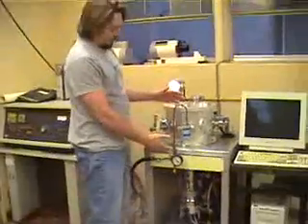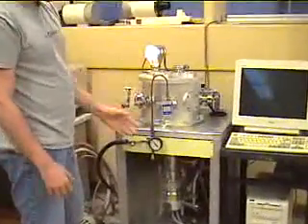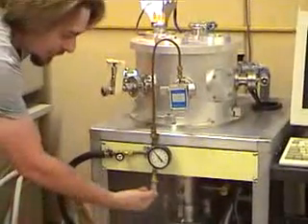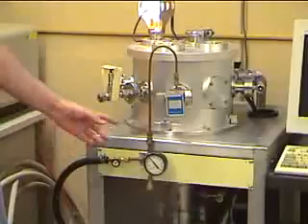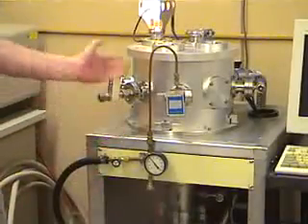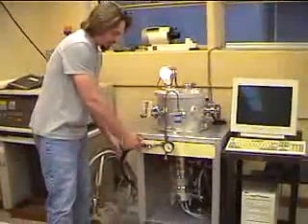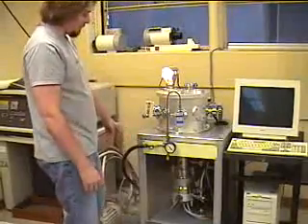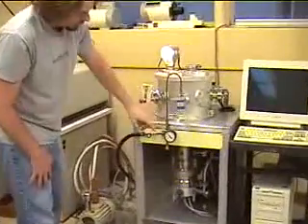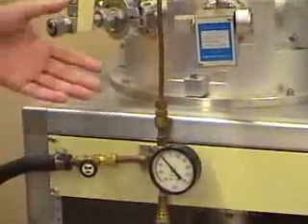In the front of the apparatus, we have the gas handling system. This gas handling system is responsible for getting sample gases into the vacuum chamber. Your samples would be plugged into here, and as soon as you do that, you want to go ahead and vacuum out any air or other residual gases that might have been left inside the gas handling system. You do that by turning this little knob right here. It vacuums out the system using this rough pump off to the side. This little gauge right here tells you what the pressure is inside the gas handling system relative to atmospheric pressure.